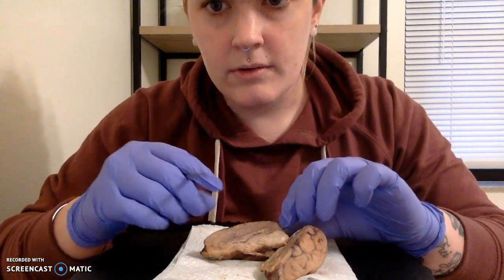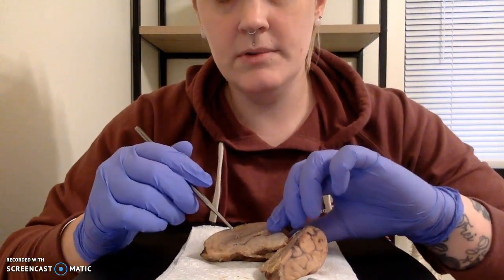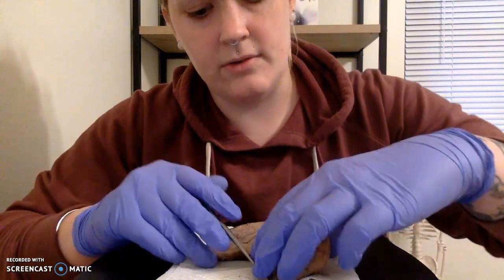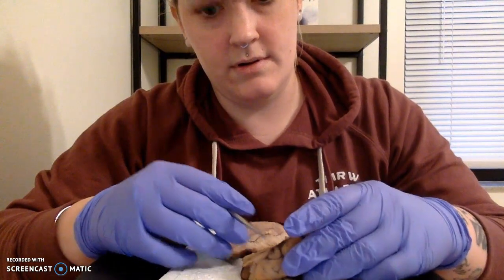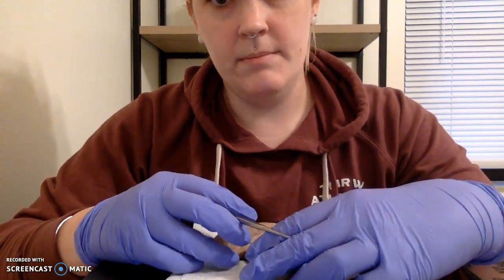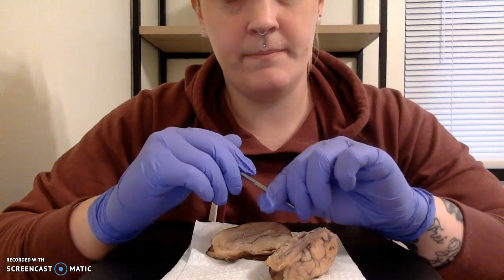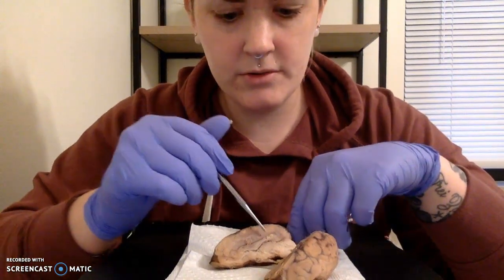Okay, so then we are going to look for our thalamus. Our thalamus is going to sit right, it's kind of a roundish feature. It should be right in here. Actually, I think we might have a better view on this side. Okay. So then I want to look at our hypothalamus, which is going to sit closer towards the bottom of the brain of the dissection here. Okay, we've got a much better view now. I apologize for that.